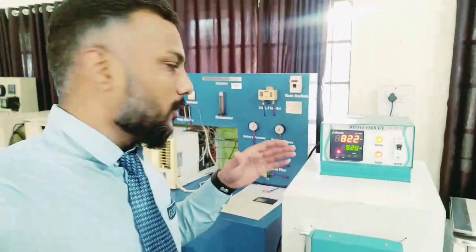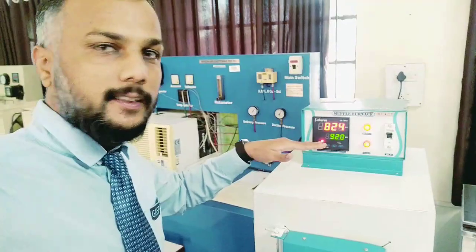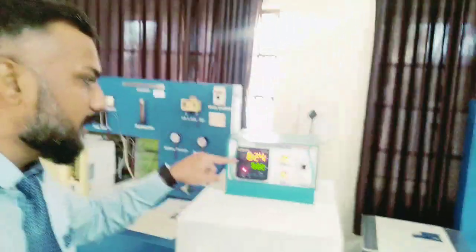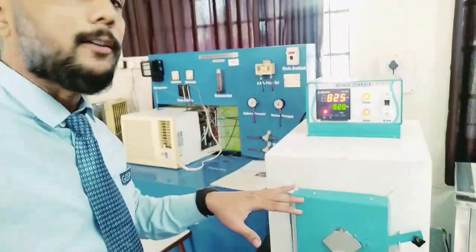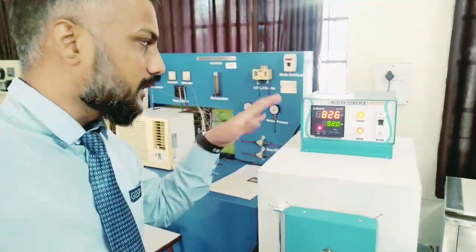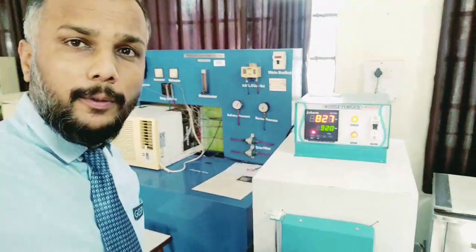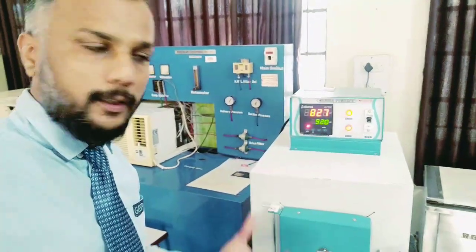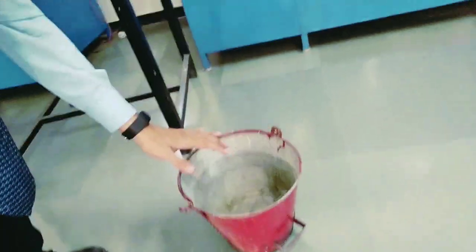We have set the temperature value to 920 degrees Celsius, and you can see 824 degrees has been achieved. Our component is almost ready because that is the transformation temperature for plain carbon steel, and our component is of plain carbon steel material.